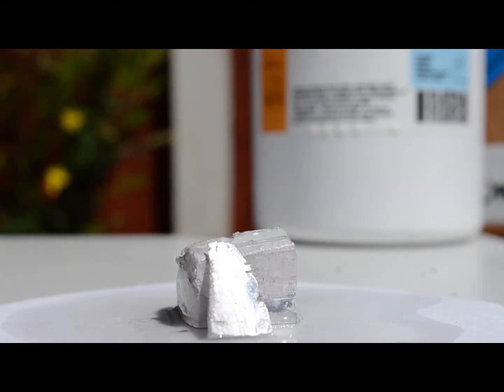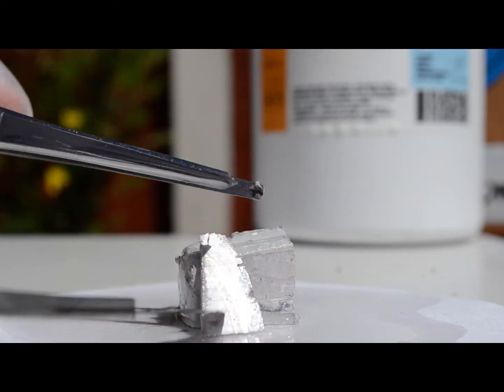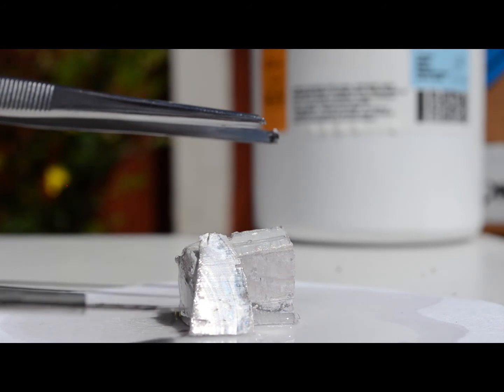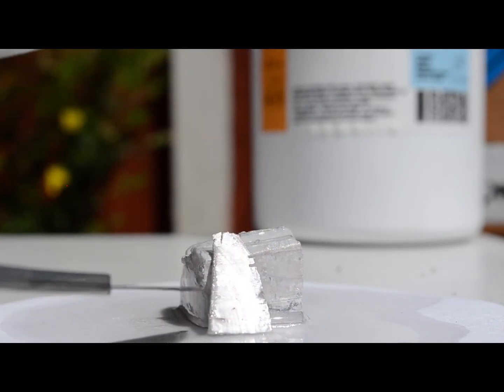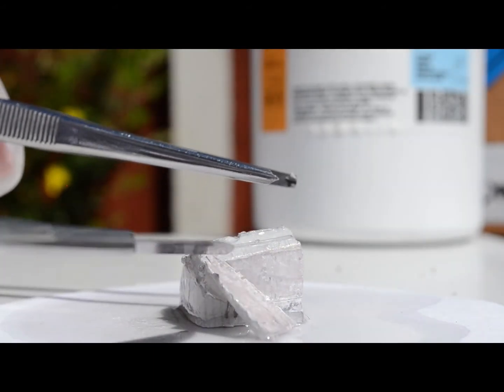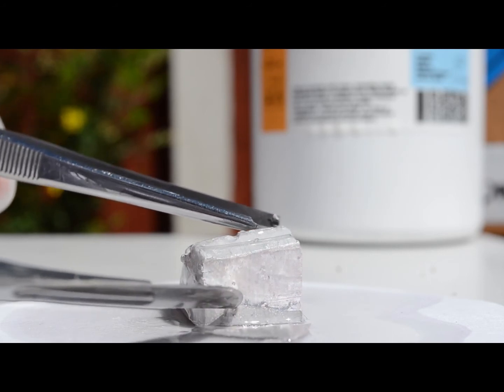Sodium metal itself is used as a dehydrating agent in the lab. It can be anyway, because it will take the water from pretty much everything to make this sodium hydroxide.